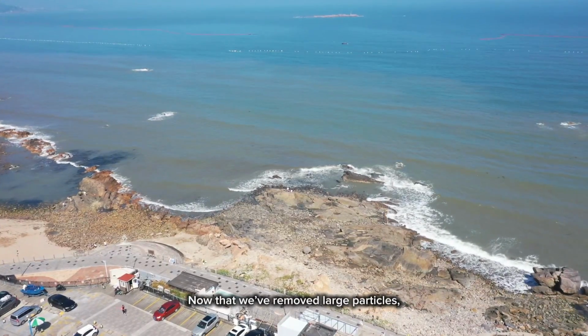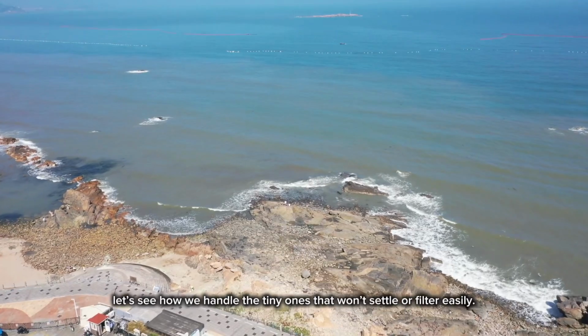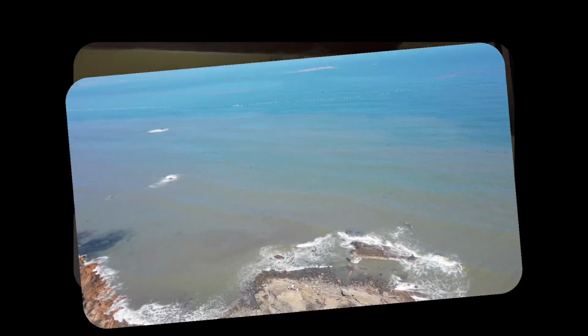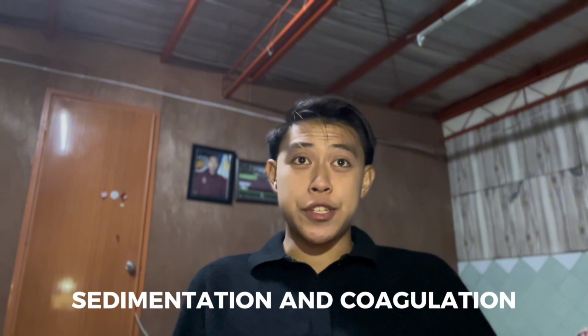Now that we've removed large particles, let's see how we handle the tiny ones that won't settle or filter easily. So what's the next method? Next is sedimentation and coagulation, which helps remove suspended particles too small to settle naturally. We filled two test tubes, one with sand and water, and the other with clay and water, and shook them well. The sand settled quickly because it's heavy. The clay stayed cloudy because its particles are too small to settle.